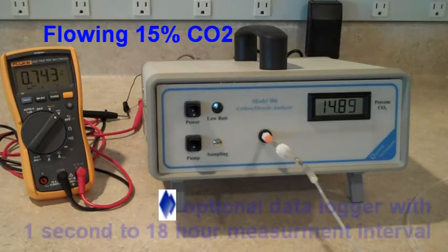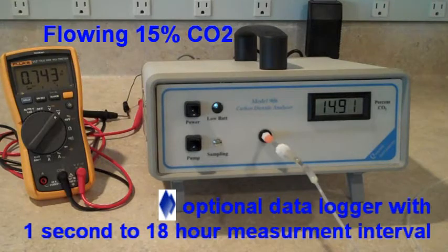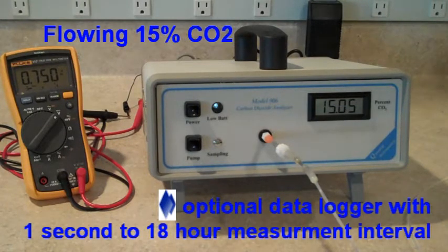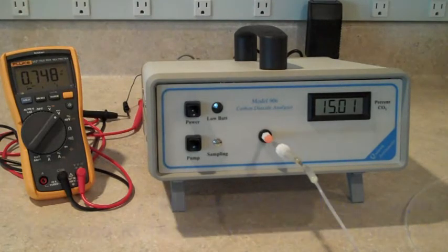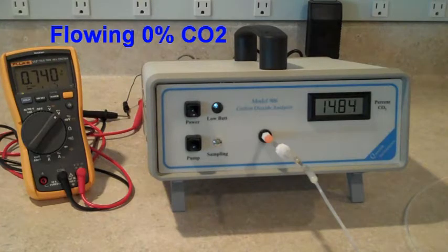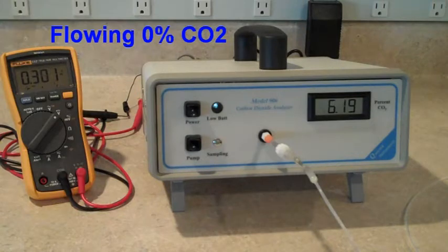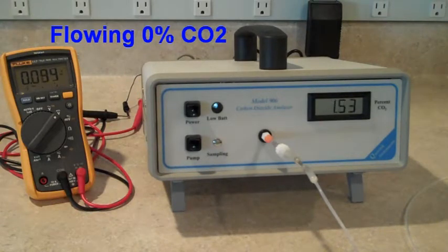Now we can provide this analyzer with a data logger, which will record measurements at a rate of 1 per second, or 1 every 18 hours, and can record up to 40,000 measurements. This data logger is optional, and can be provided to you should you not have your own data acquisition equipment in your lab.